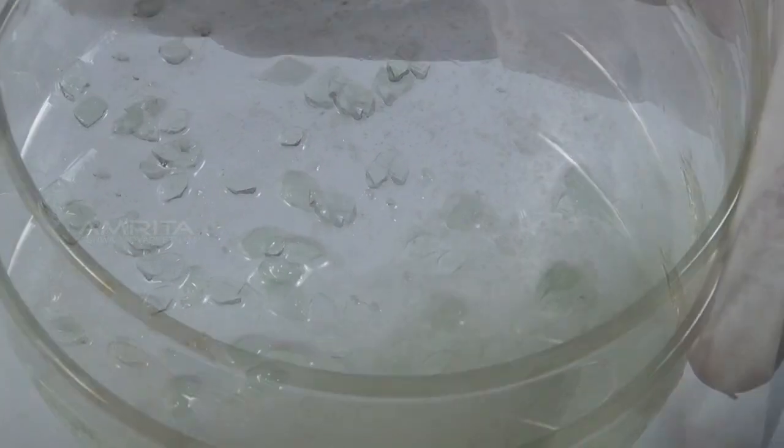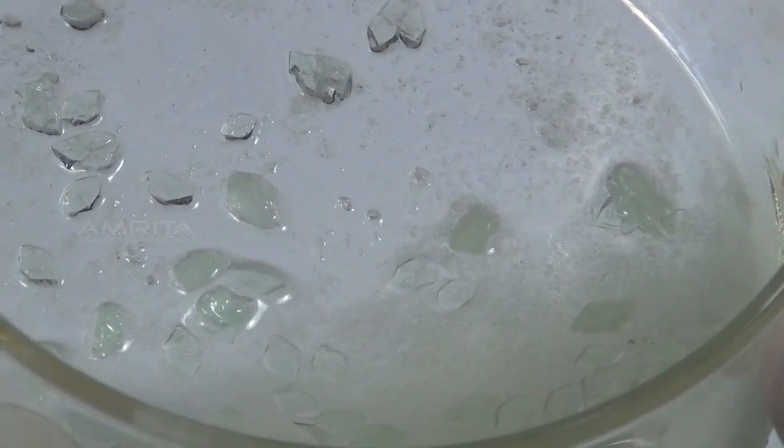On cooling, pale green crystals of ferrous ammonium sulphate separate out.